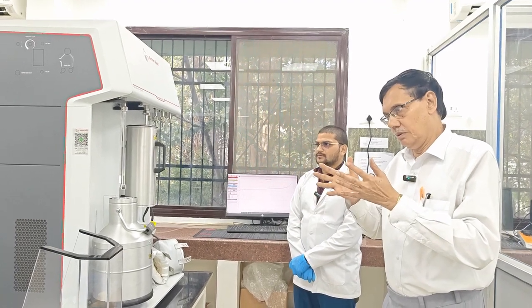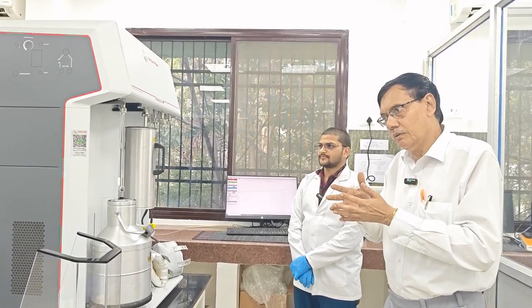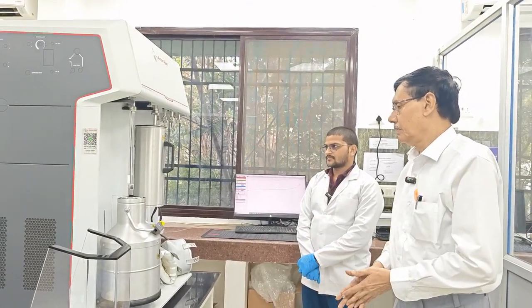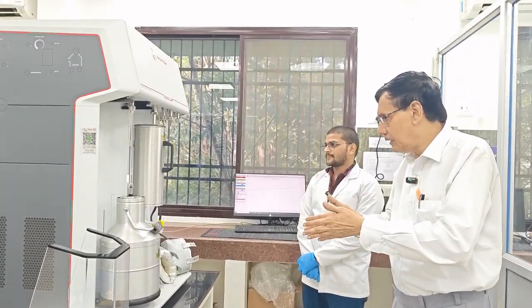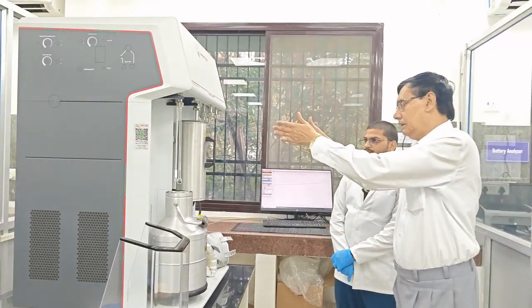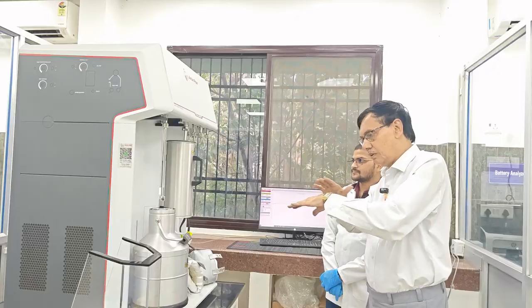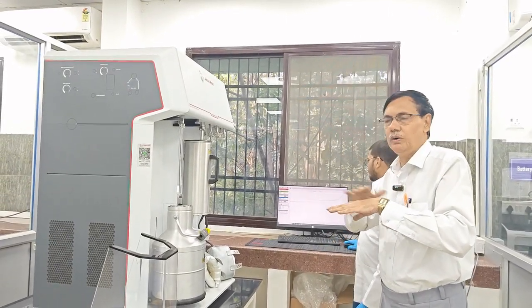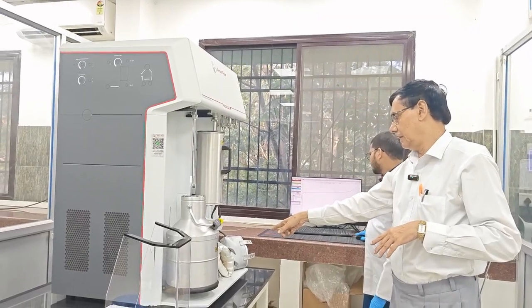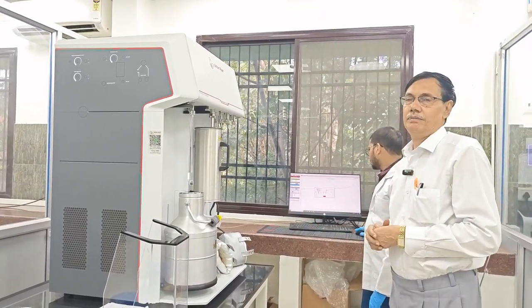So you have to understand first the theory, which I have already discussed, and then of course the experimental setup. Remember the first part is the weighing part, and we will use different types of sample tubes. Then the second part is the degassing part, because there should be no impurities. Therefore we are using degassing at very high temperature with the heating mantle.